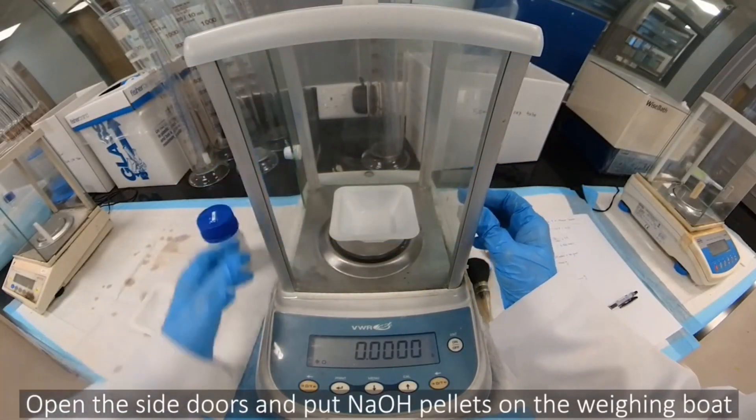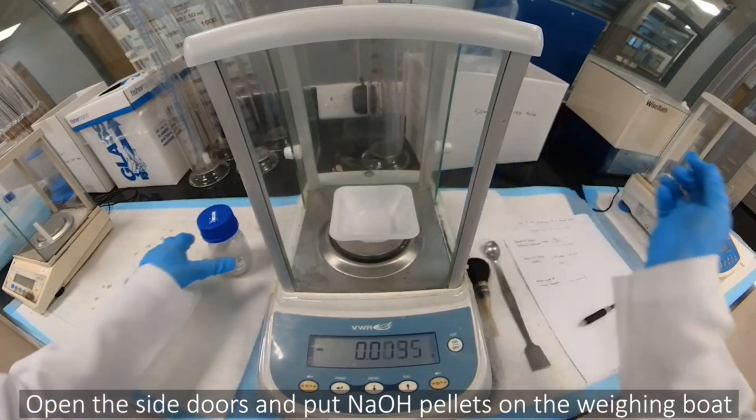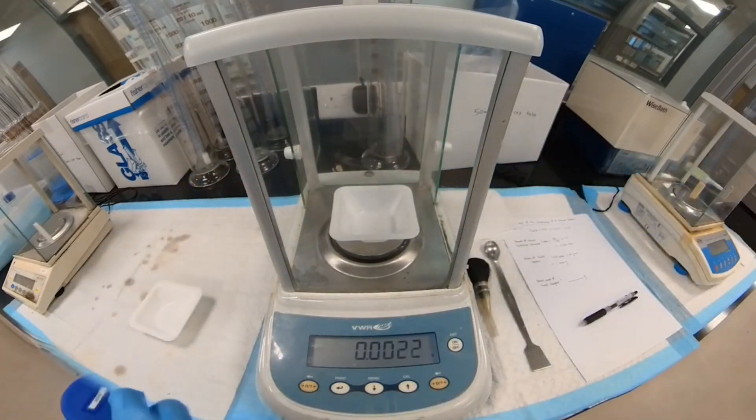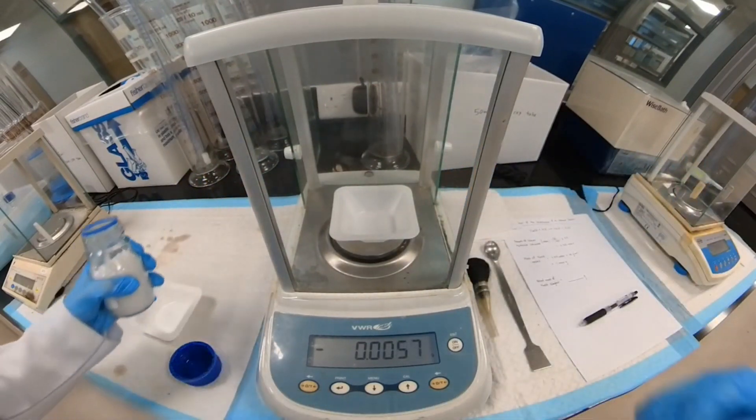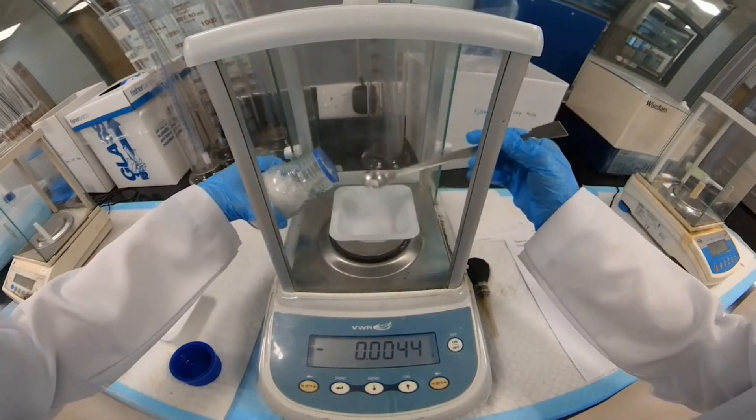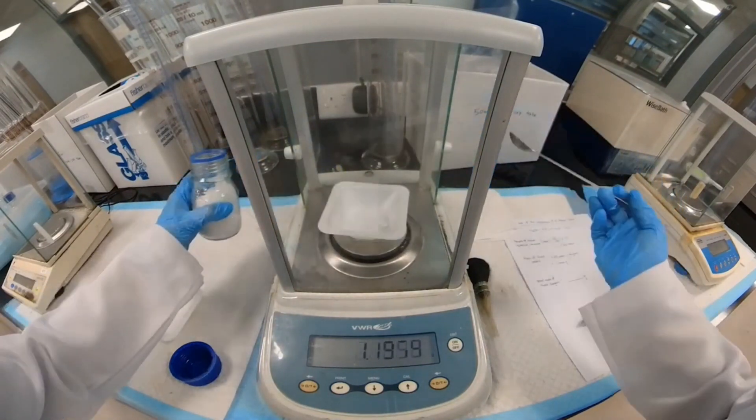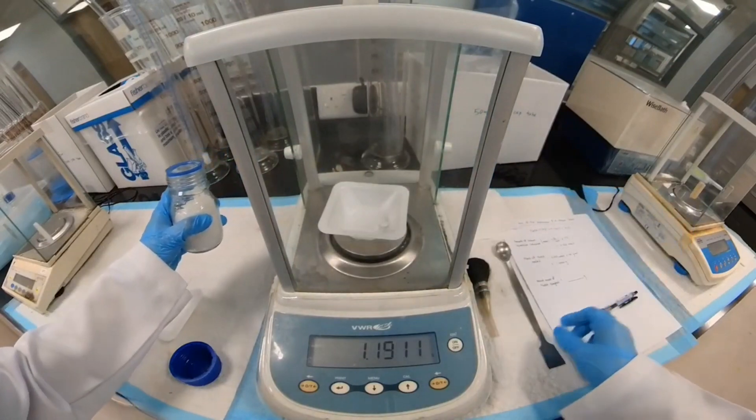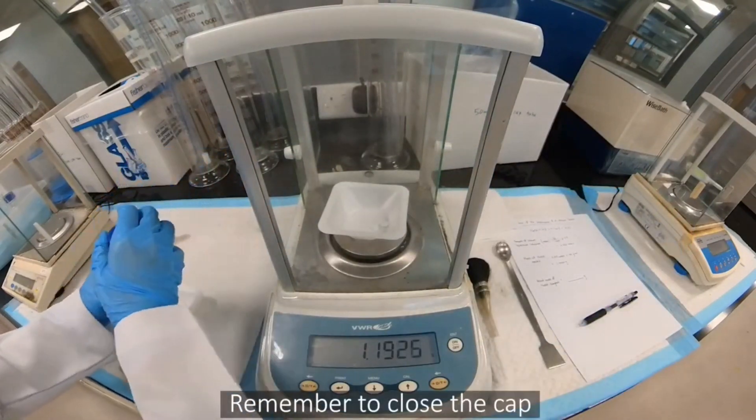Open the side doors and put NaOH pellets on the weighing boat. Remember to close the cap.